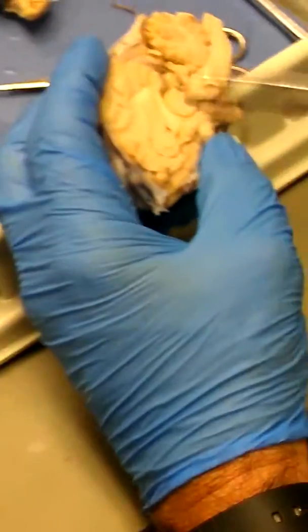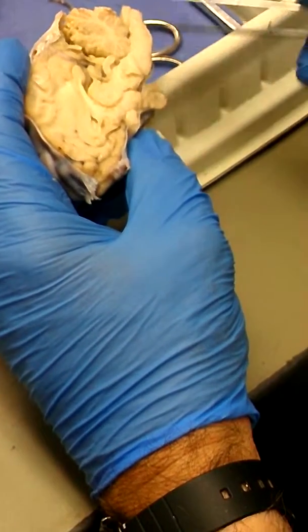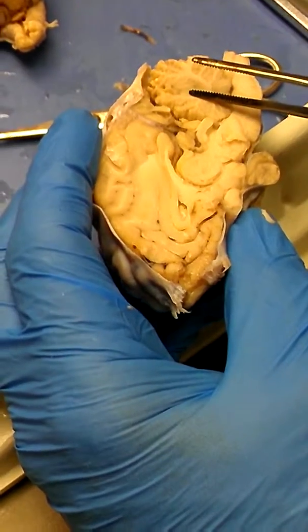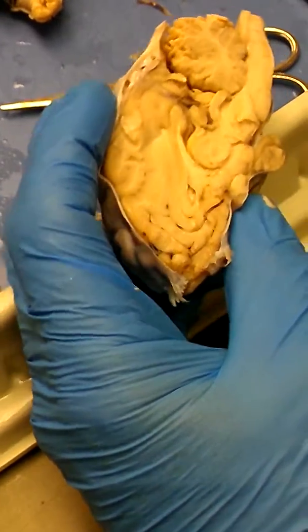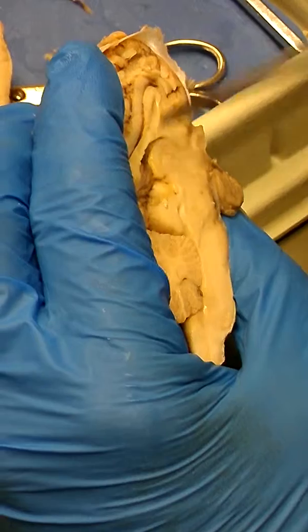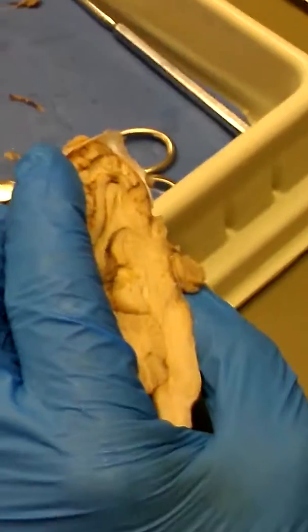Okay? So, again, pineal, thalamus, hypothalamus, anterior, posterior pituitary, optic chiasm, medulla, pons, cerebellum, arbor vitae, superior, inferior colliculi, cortex, better on this one, corpus callosum, third ventricle, lateral ventricle, fourth ventricle. Lateral ventricle is the first ventricle and second ventricle fused together. That's where they went. Okay?